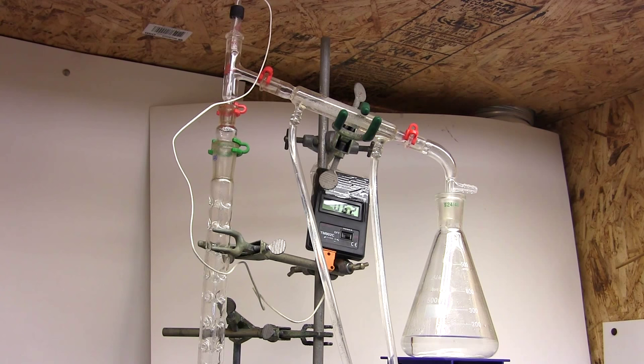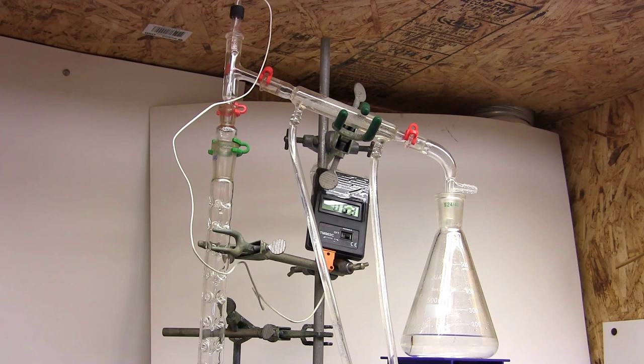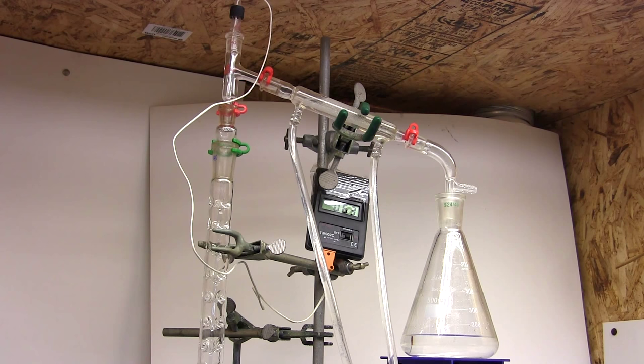While I can still separate the components further just using my amateur equipment by using additional techniques, it's not worth my time. I won't discard it though. The azeotropes are still 88% methanol and thus still useful as an impure source of methanol if the other components are not reactive toward my chemistry.